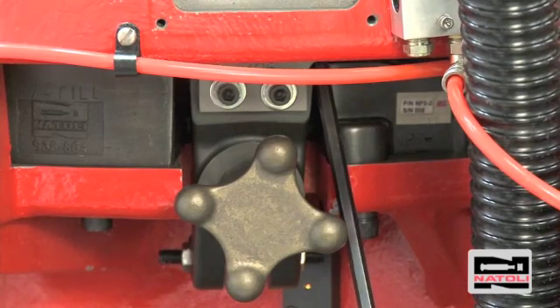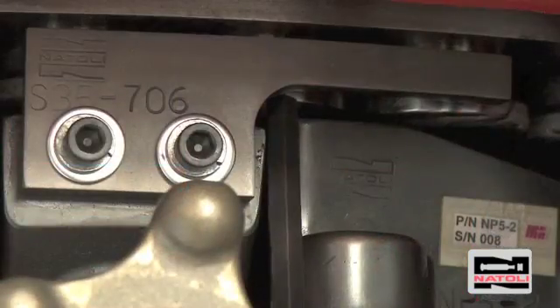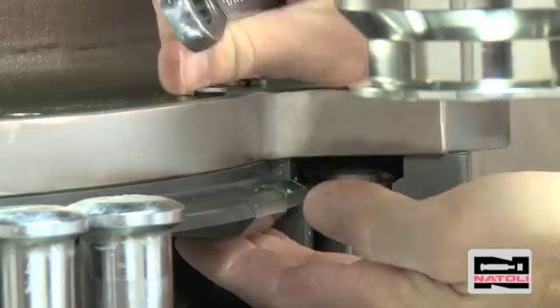Check and be certain the anti-flight rail on the lower takeout cam does not allow for much movement. You don't want to pinch the head, but you also do not want the punch too high up out of the die. Next, reinstall the upper punch takeout plate.